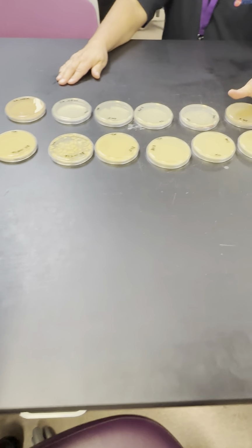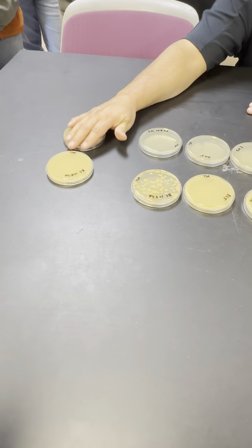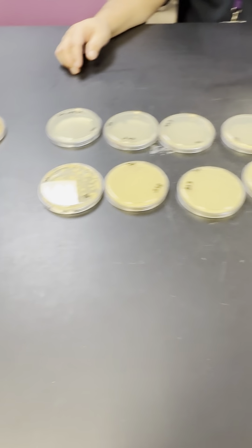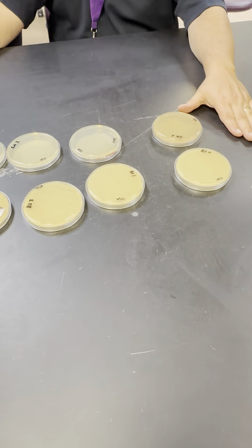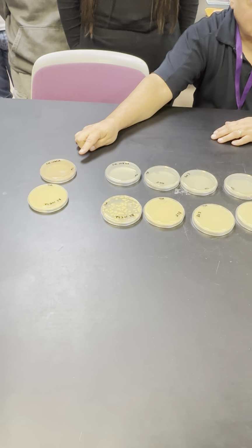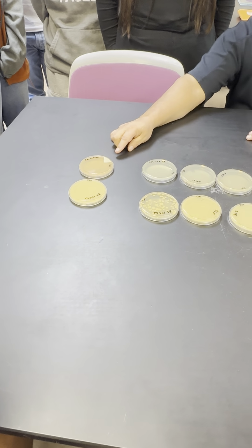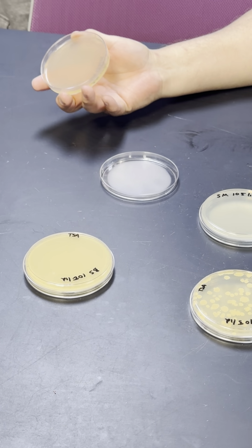So can you appreciate that the controls and the plates that were done at 10 minutes with the lid look exactly the same? That's because the control showed what they look like when they're in their perfect state. They're not exposed. Here, they were exposed for 10 minutes, but they had the lid, and plastic or glass stops UV completely. So you can see how beautiful that lawn is on there. They're just completely covering the plate.